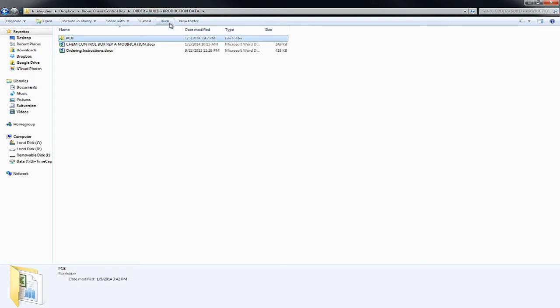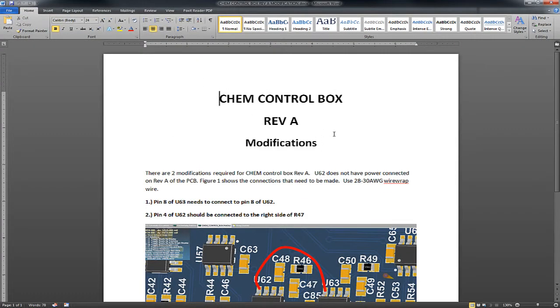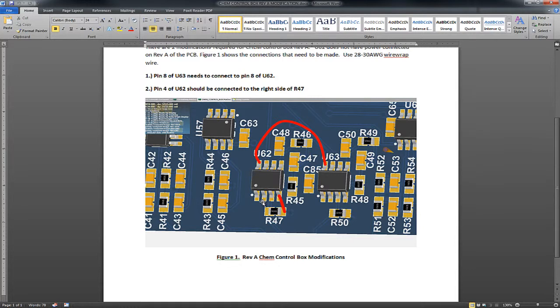The only thing I did want to mention about revision A, there's a couple of minor mistakes in revision A. This ChemBox Rev A modification has instructions of what you have to do once you build up the entire design to get it to work. The prototype you're going to deliver has these made, but basically there are some forgotten power connections on the schematic, and you have to put a wire jumper between 2 pins of 2 chips, and then between a resistor and a pin. It basically connects power to U62. It's forgotten about on the schematic. That's the only thing on Rev A you need to do. Rev B integrates this fix into the circuit board itself. So this fix is only needed on Rev A of the first 5 units that we ever made.